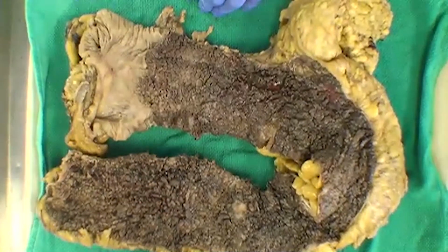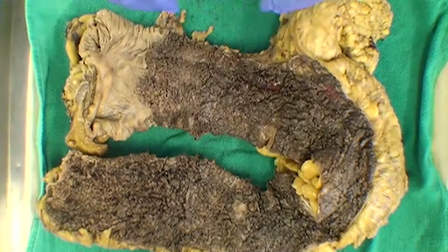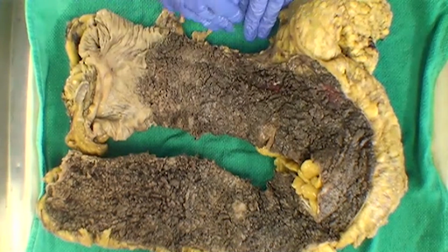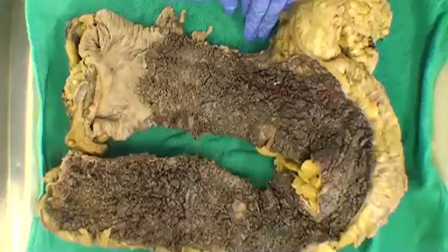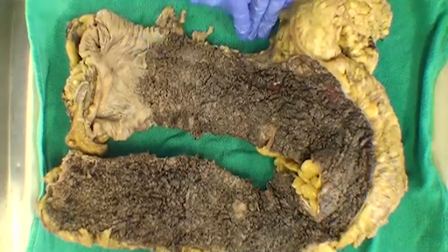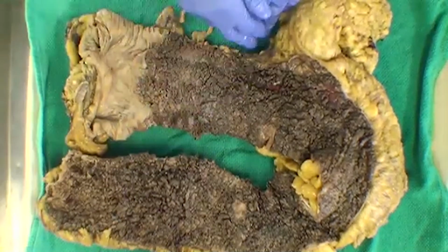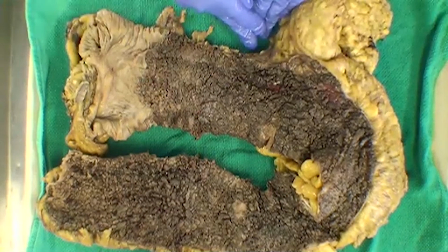We have a few other thoughts here that say ulcerative colitis, so that's good. That's the history we've been given for this specimen. So this is a very nice example of ulcerative colitis. We have diffuse involvement starting distally and moving proximally with a very abrupt transition at the cecum. Certainly you can get this sort of polypoid appearance in areas. These are probably going to be inflammatory polyps or pseudopolyps if we were to look at them under the microscope.